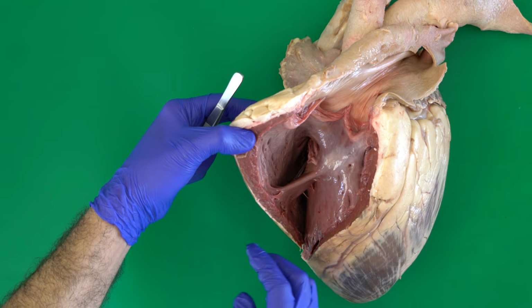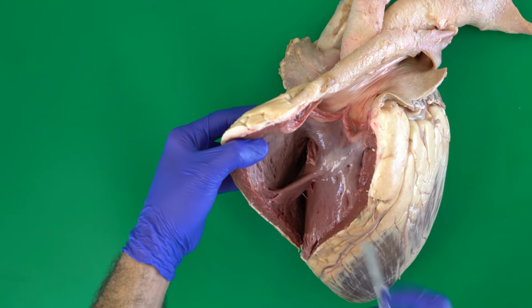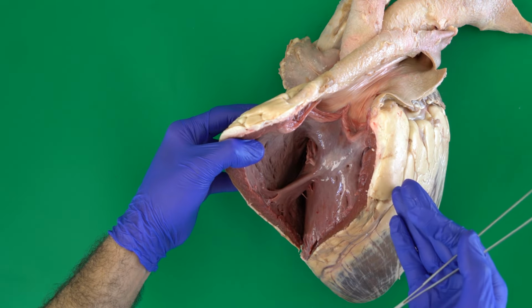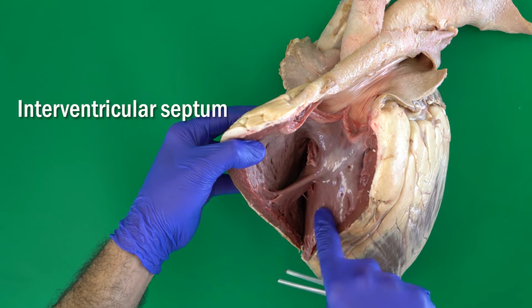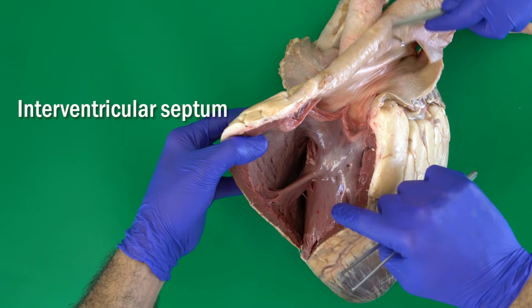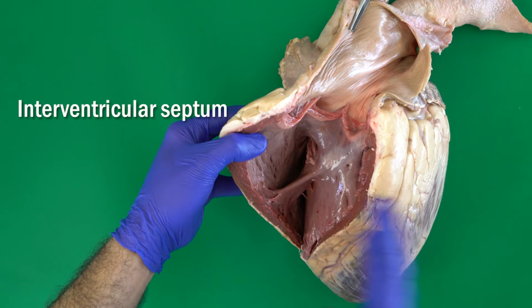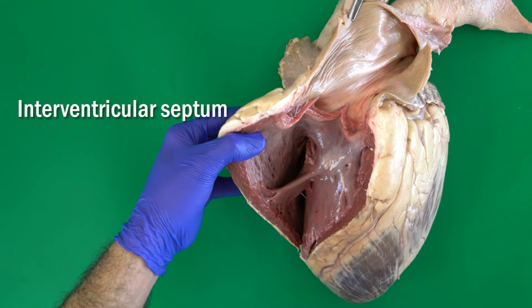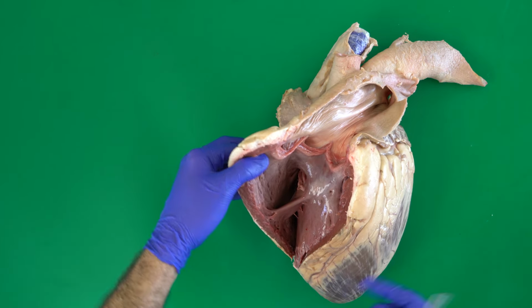So once we open this, as you can see here, firstly, let me just tell you that internally we have what's called the ventricular septum. The ventricular septum is a very thick muscular structure located between the left and the right ventricle. This is here the interventricular septum.